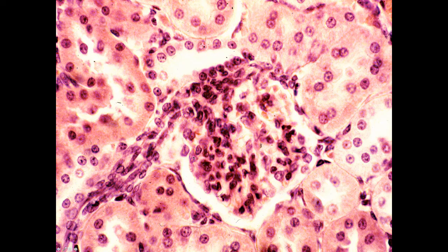A higher power view of a renal corpuscle, I can clearly see the urinary space. You can see the parietal layer of Bowman's capsule. Here I'm looking at the visceral layer of Bowman's capsule. I cannot distinguish in the light micrograph differences between the endothelial cells and the podocytes. Here is a vessel coming into the renal corpuscle, or it's a vessel coming out. So this is a profile either of the afferent or efferent arteriole. I don't know as I look at this.